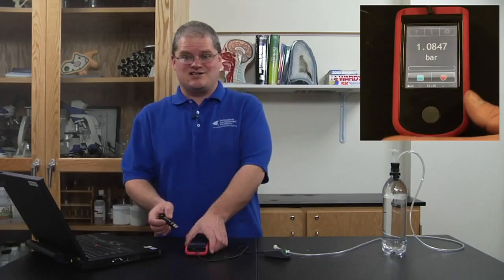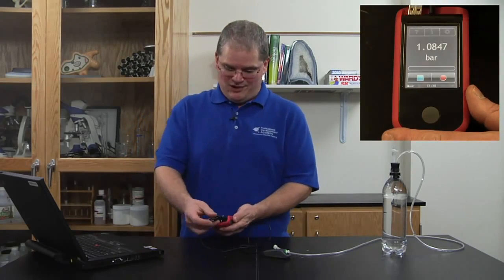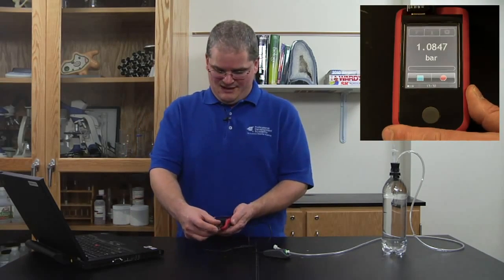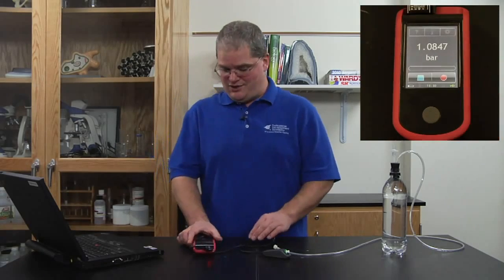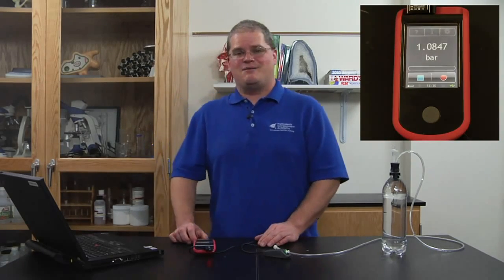To begin the experiment, I need to insert a USB drive into the port at the top of the unit. When you do that, you will see the green USB icon at the bottom right light up.